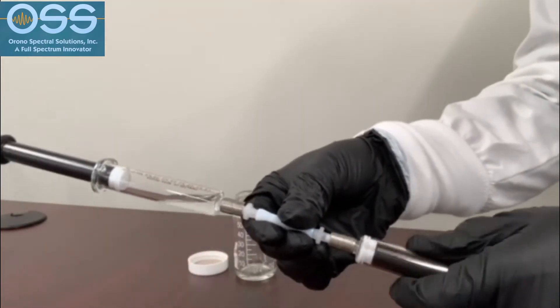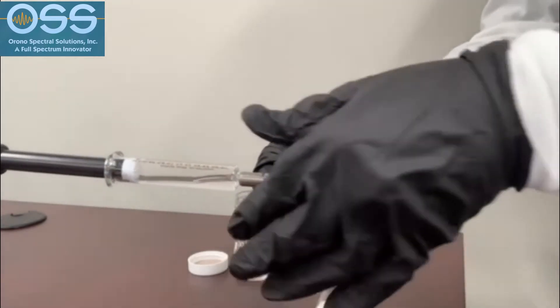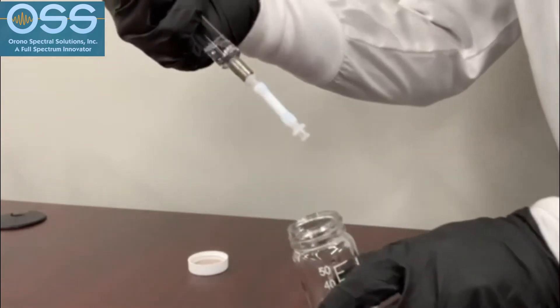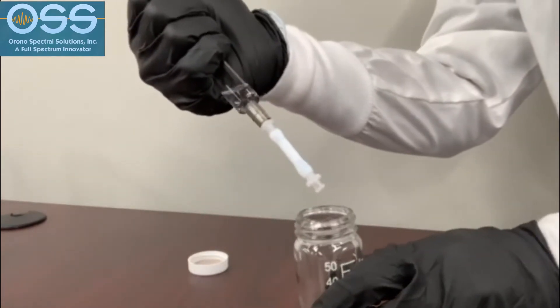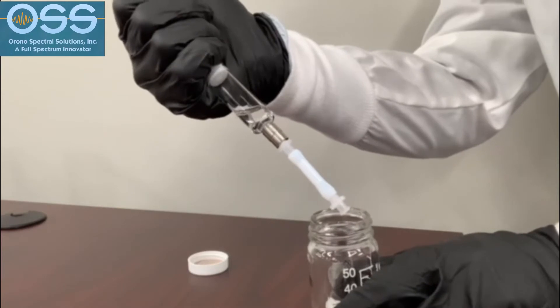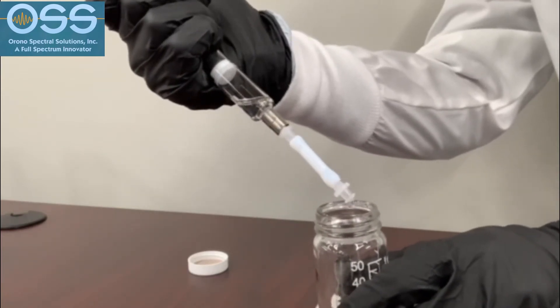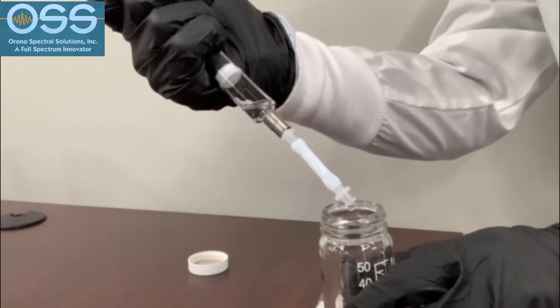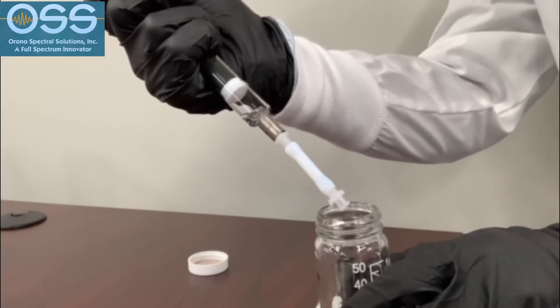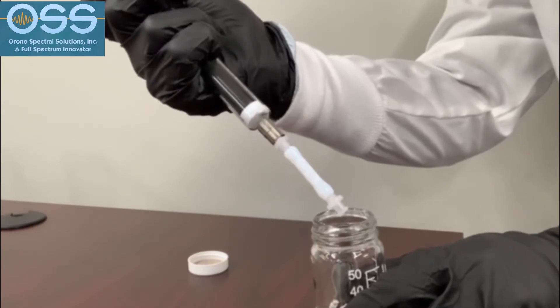Then disconnect syringe A and deposit the sample from syringe B into a graduated 50 milliliter glass jar. This final pass through the NICE column ensures that all of the polar material from the sample has now been trapped in the column and all that now remains in the solvent is the nonpolar portion of the total oil and grease.